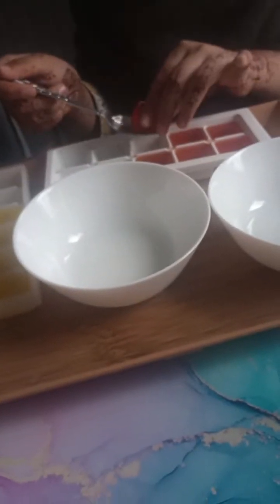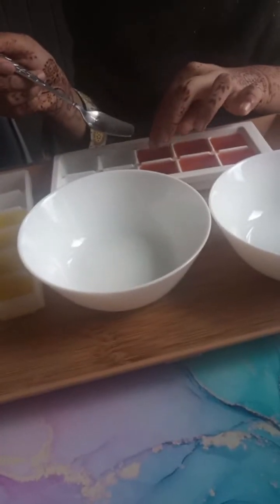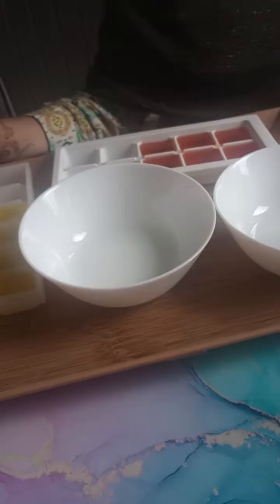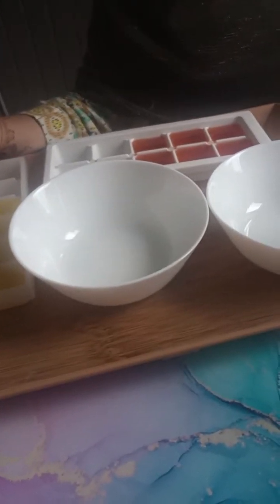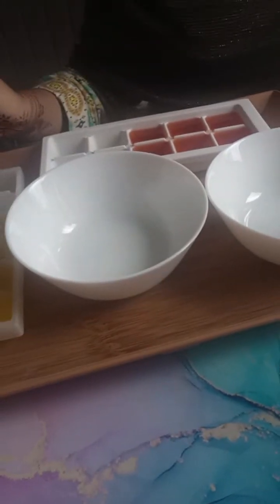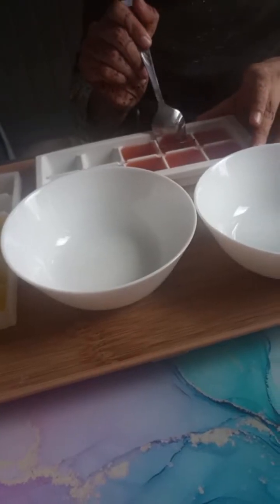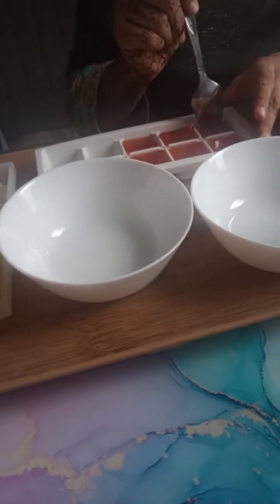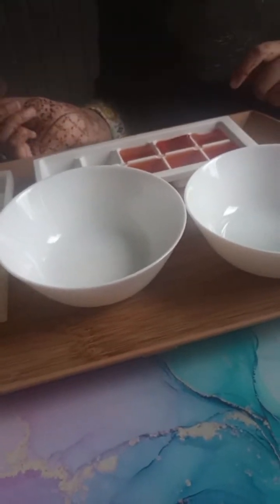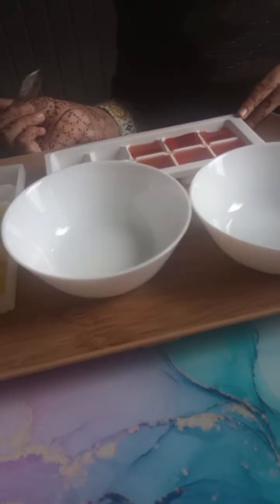So today's topic is that we're studying biology, and it's to do with exchange surfaces. Cells can use diffusion to take in substances they need and get rid of waste products. For example, oxygen and carbon dioxide are transferred between cells and the environment during gas exchange in humans. So we are going to do biology and we can't wait to do our experiment, and we're using jelly.